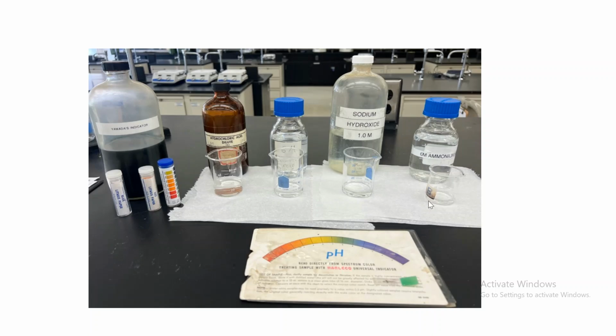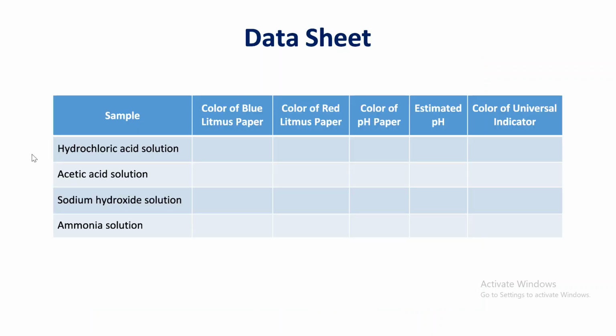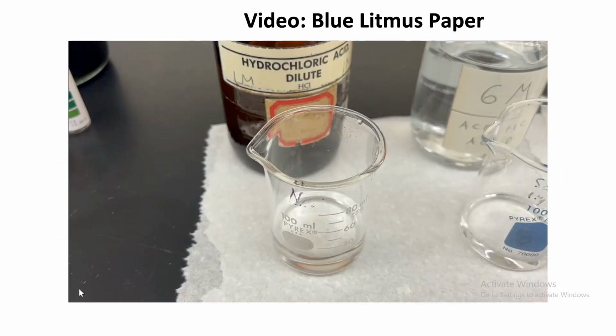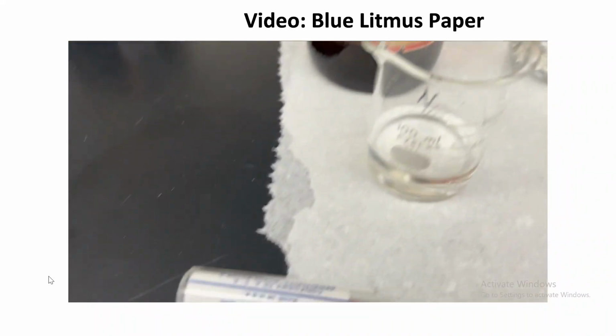Here are all the equipment that we'll be using, and let's start with the first one. The data sheet now. We're going to be putting all these samples in different types of indicators and litmus papers. So make sure to write the color of the blue litmus, color of red litmus, color of the pH paper, estimated pH, color of universal indicator. We're going to start with the first one, hydrochloric acid. So the hydrochloric acid right here.